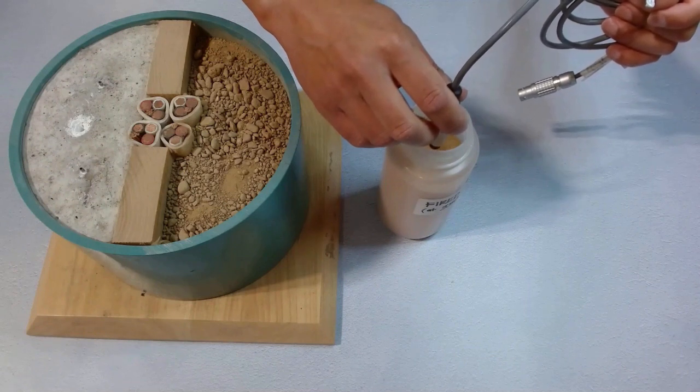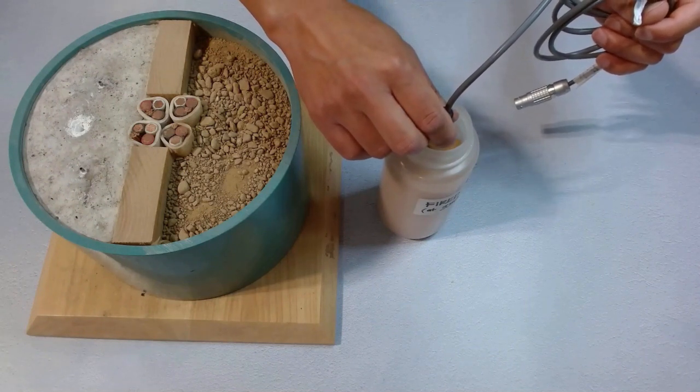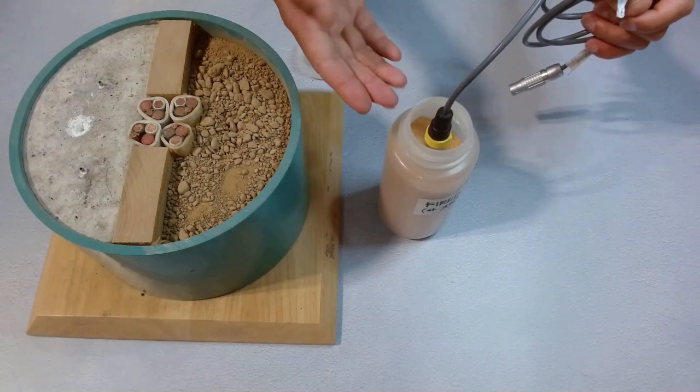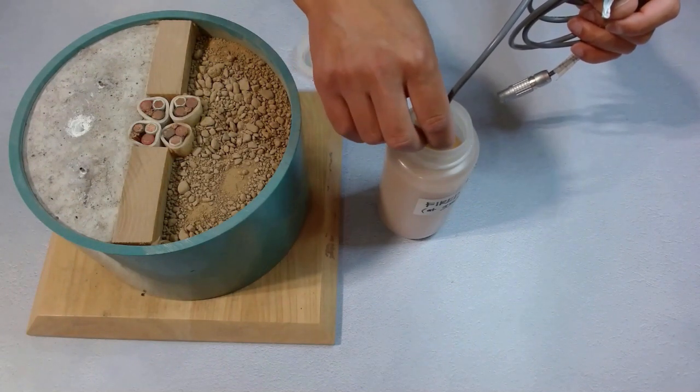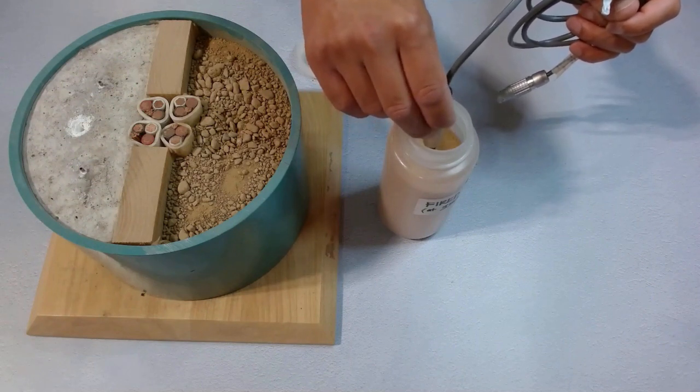Never go too fast in case there is a rock or something stopping the needle. We push the needle all the way in. It is sitting there properly. Now we try to pull it out. Again, very straight and slowly.